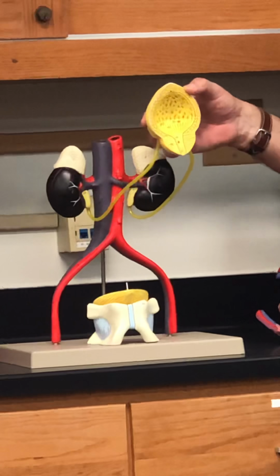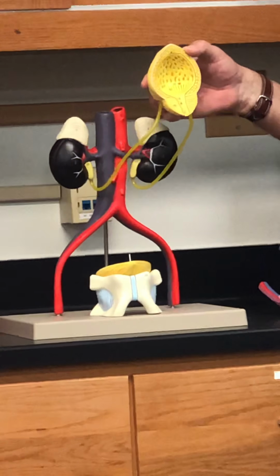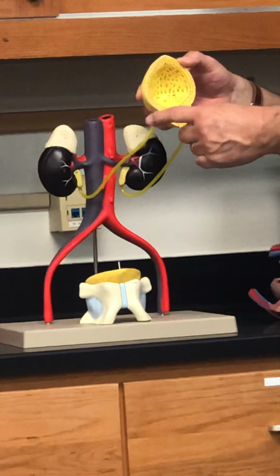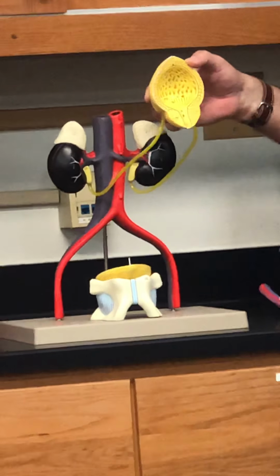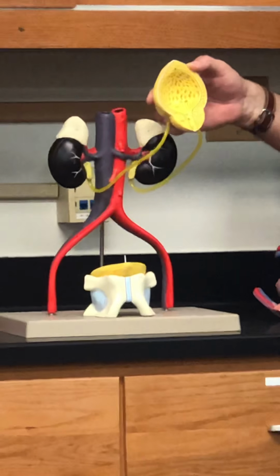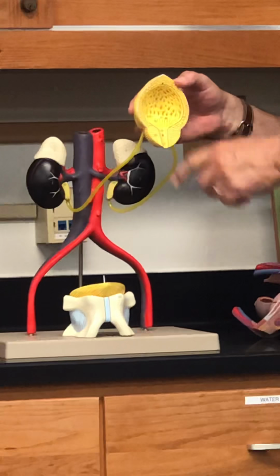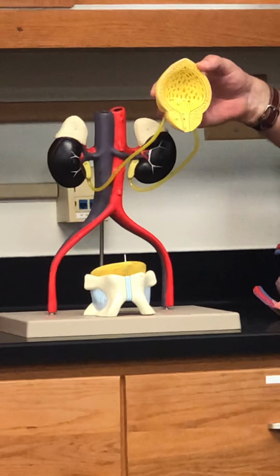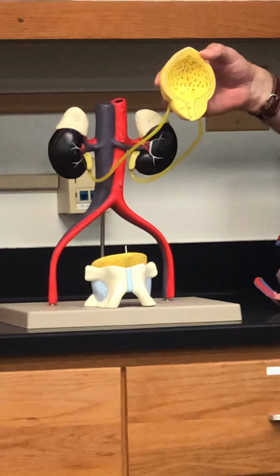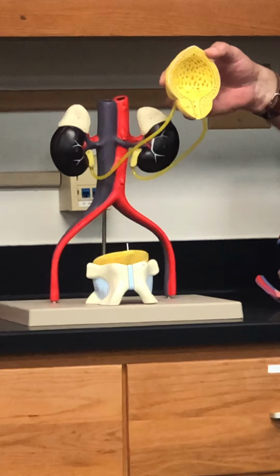And this structure? You think this is a male or a female? How can you distinguish male from female? Well, females don't have this. This is the prostate gland. Right. Prostate gland. So this is a male bladder, okay? So what's the tube called that's going through the prostate? It's the beginning of the urethra. This one, since it's going through the prostate, it's called the prostatic urethra, okay?